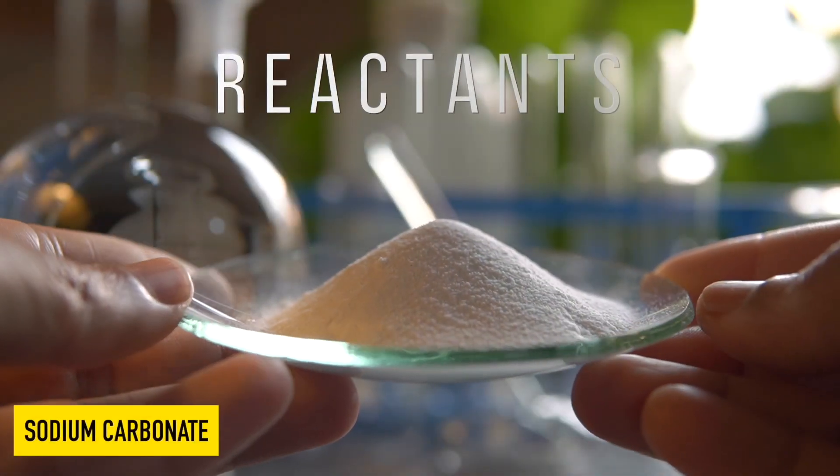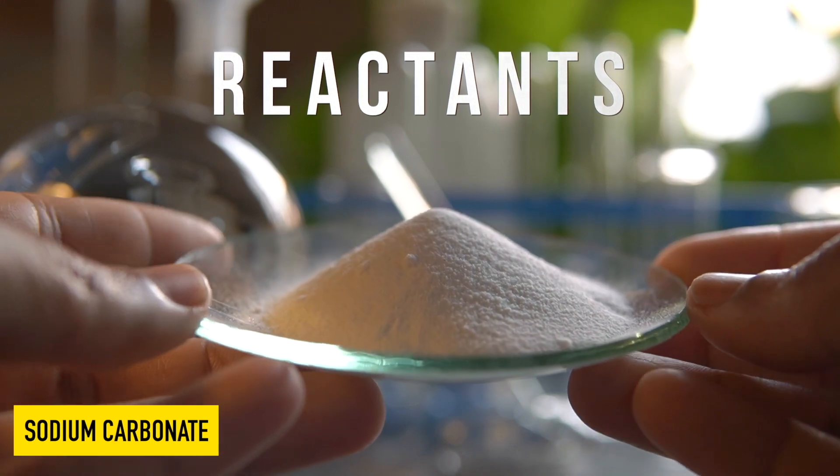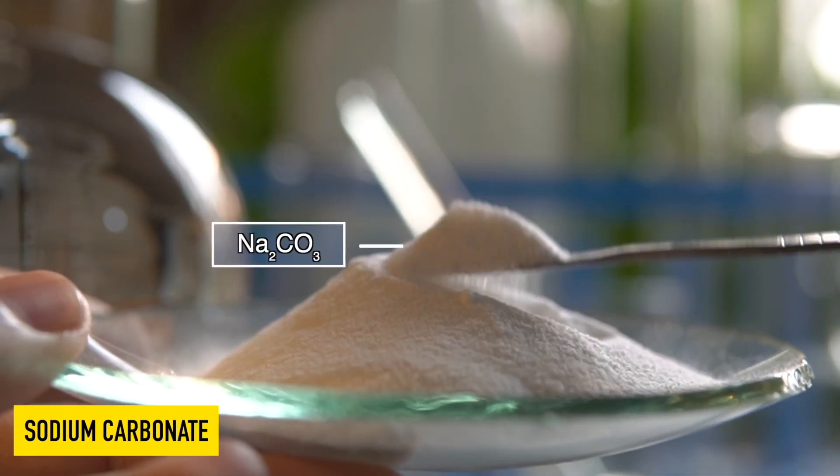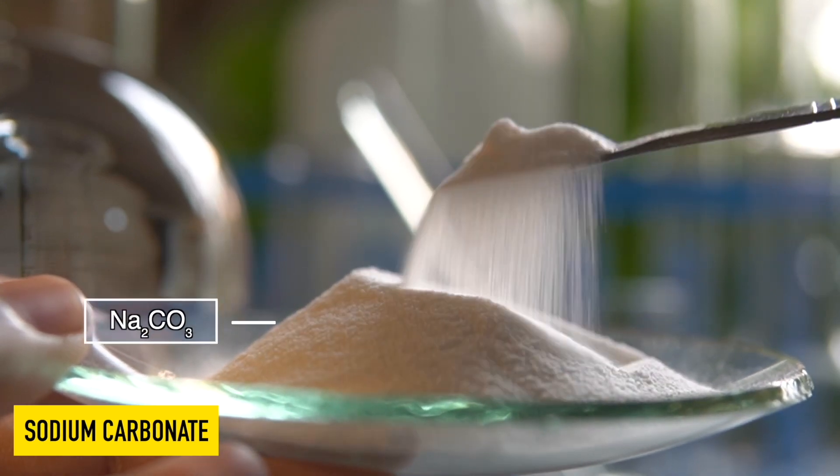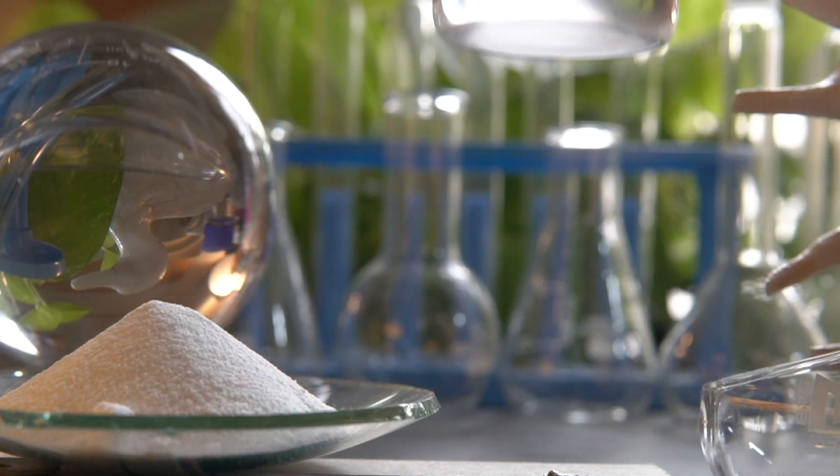This is sodium carbonate, or commonly called washing soda. It is a white powdery substance and can dissolve in water very easily to make a clear homogeneous solution.